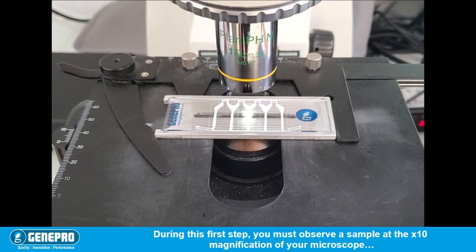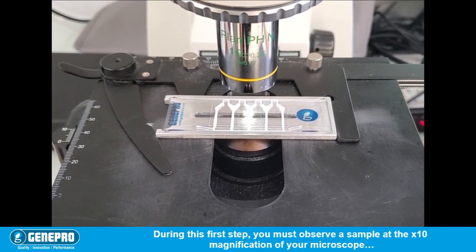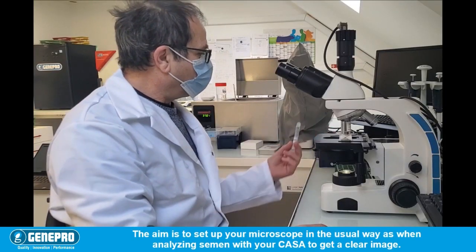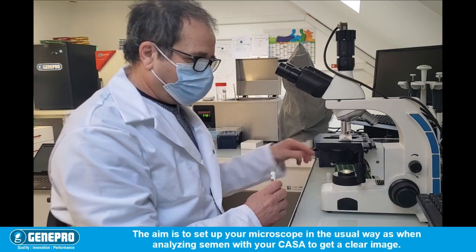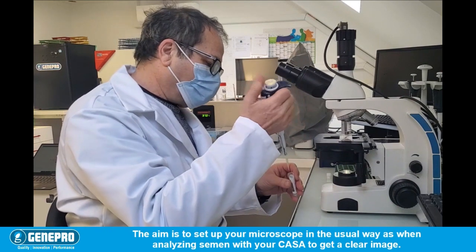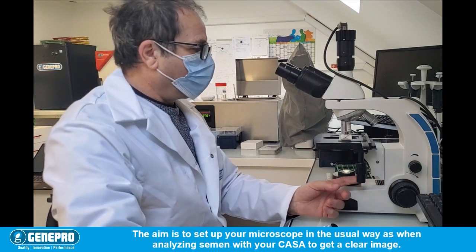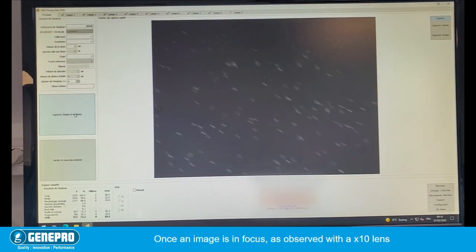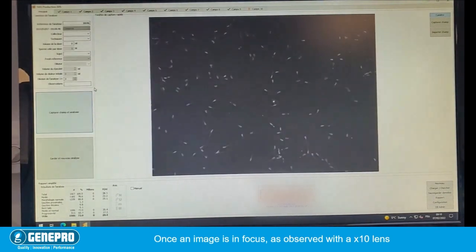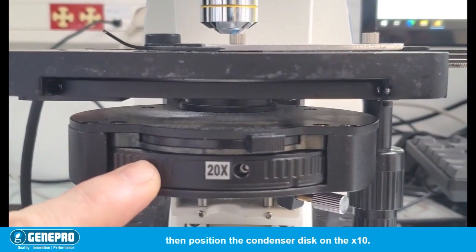The first step is to center the condenser. During this first step, you must observe a sample at the 10x magnification of your microscope. The aim is to set up your microscope in the usual way as when analyzing semen with your CASA, to get a clear image. Once an image is in focus as observed with a 10x lens, then position the condenser disk on the X10.